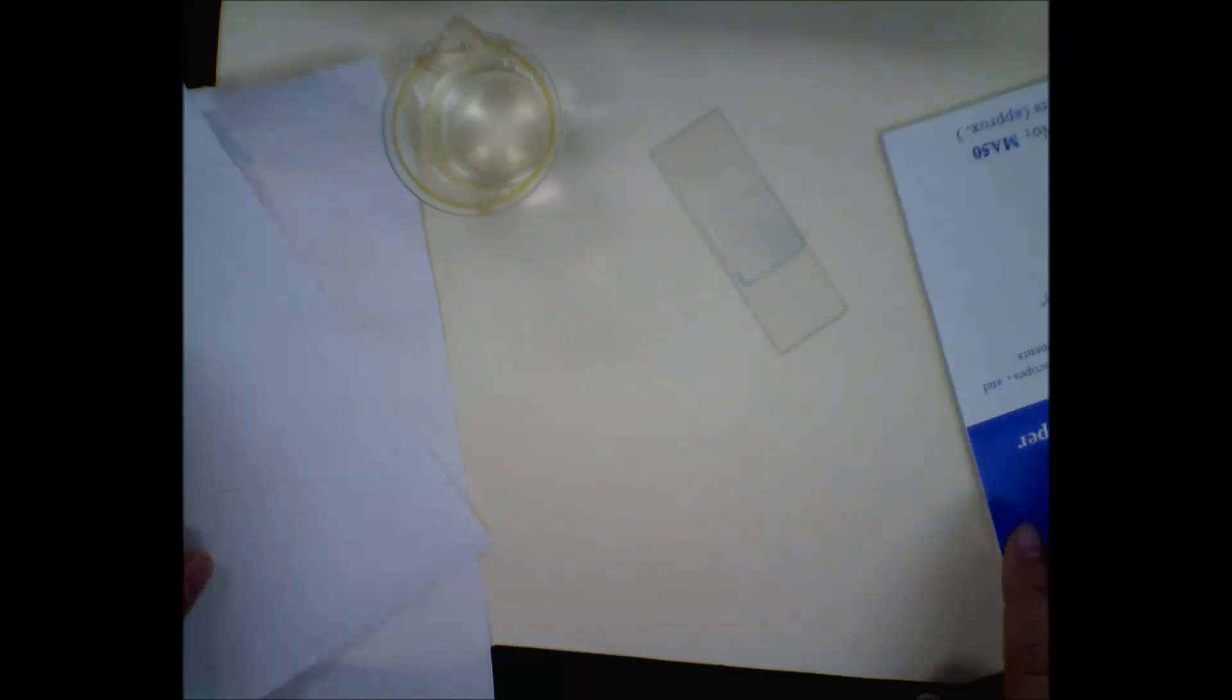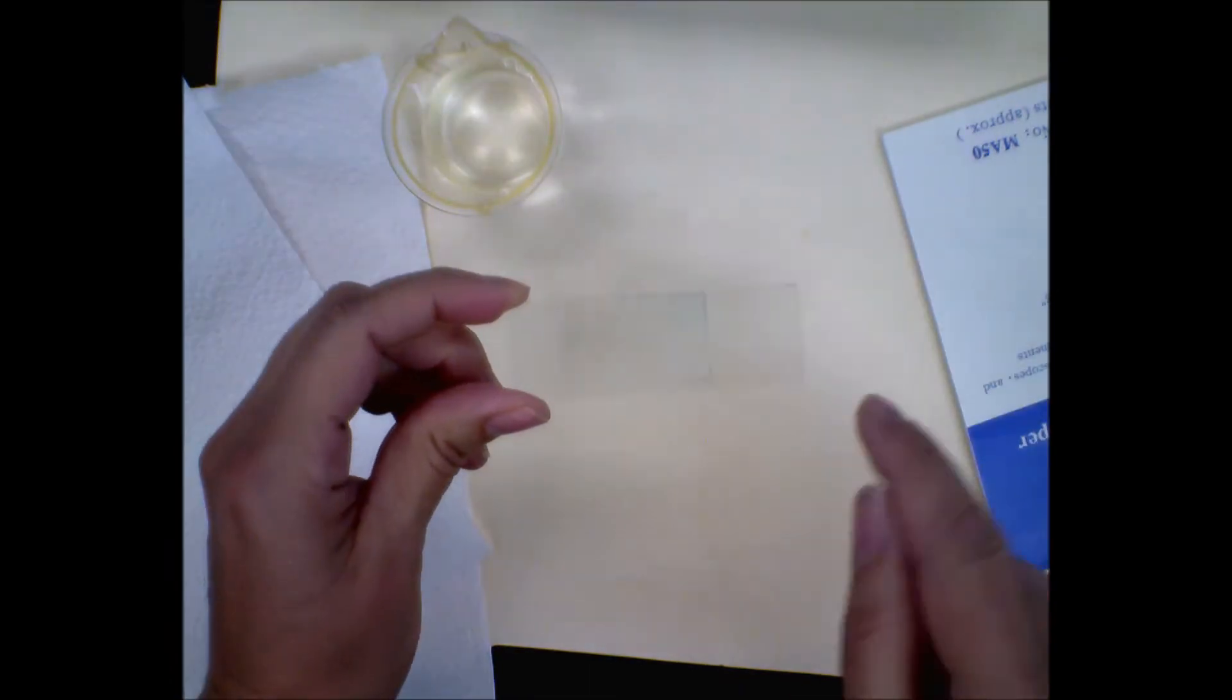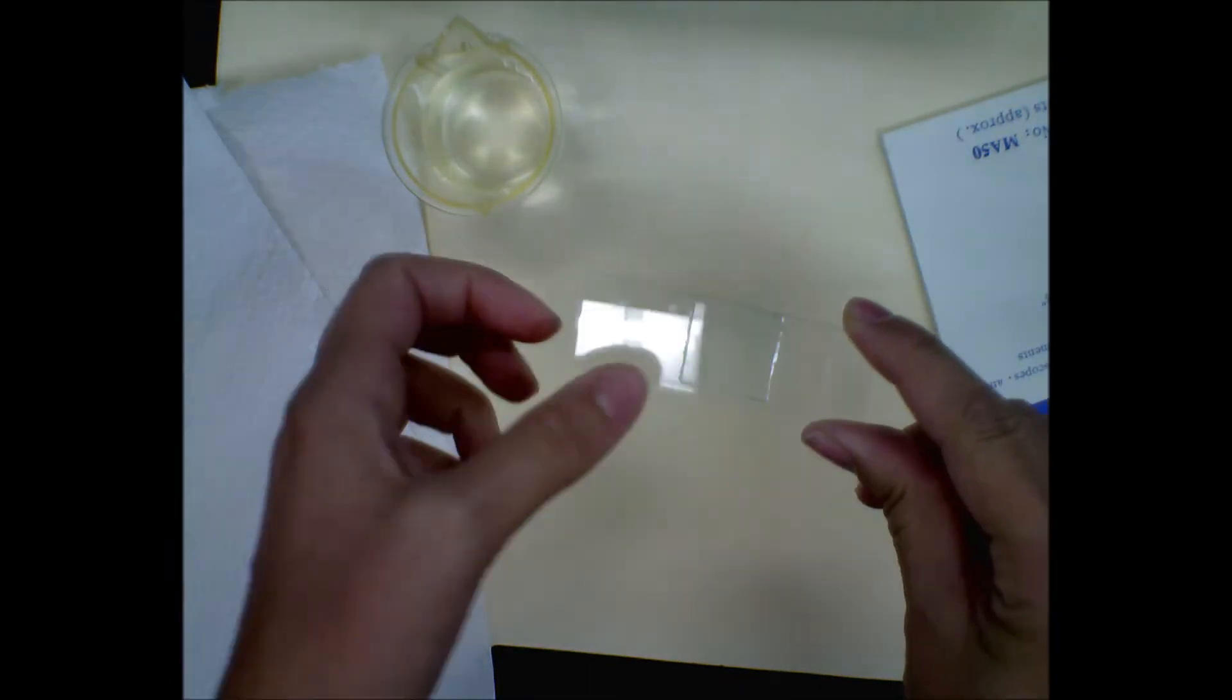Alright, now we have the materials here to clean the slides. Once you've made your wet mount, you do need to clean it. We're not going to leave it for someone else, we're going to clean it properly.